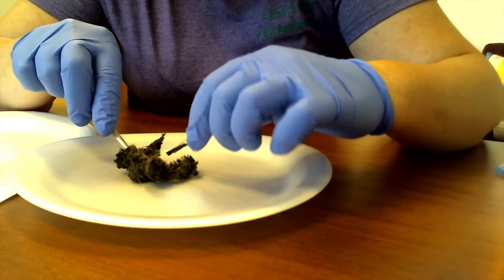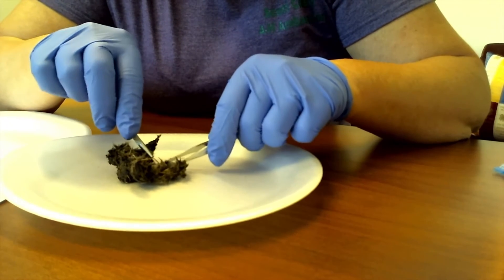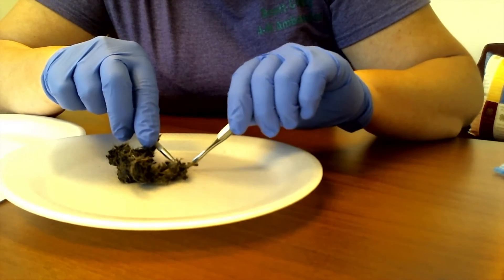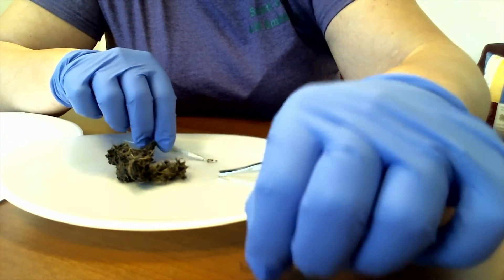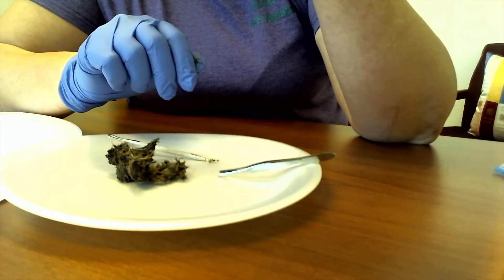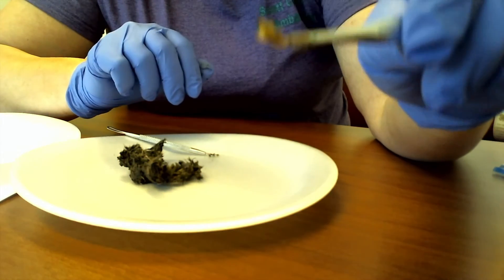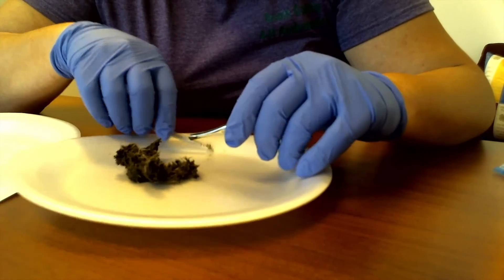Something else that you can see in here which is pretty awesome — we have an intact jaw. We actually have the top and bottom of the jaw. We have the jaw — dropped it on my desk. So we have our tiny little jaw bone with the teeth intact, which is pretty cool to find. If I grab the other one, we have that as well. Based on the pelvic bone structure and looking at the type of jaw, the way that the jaw angles out, we definitely have a vole here.